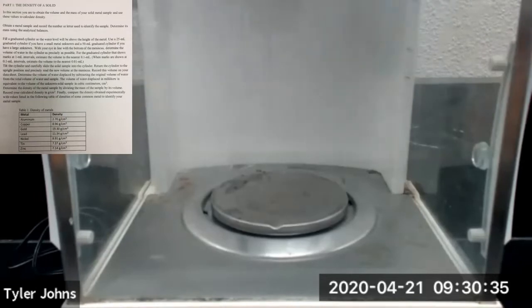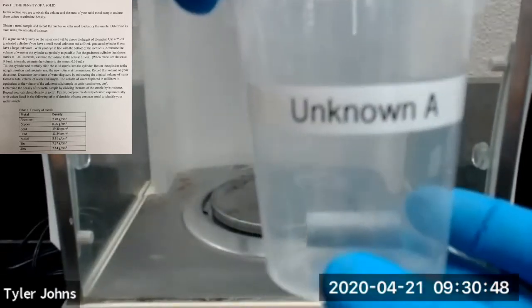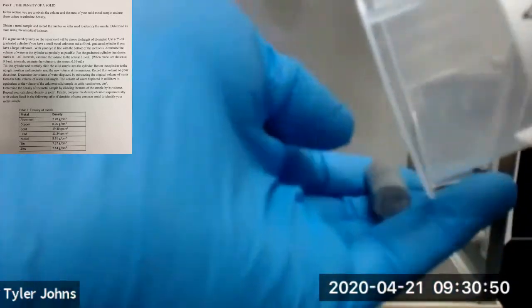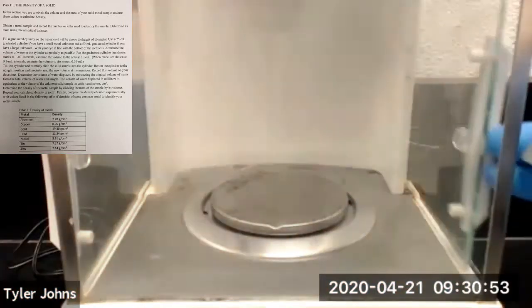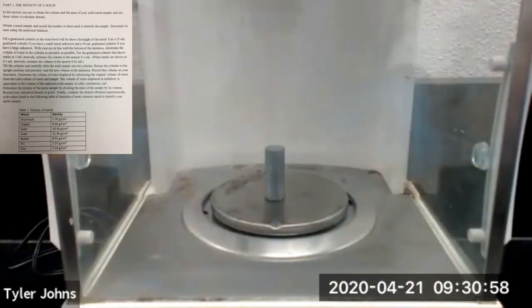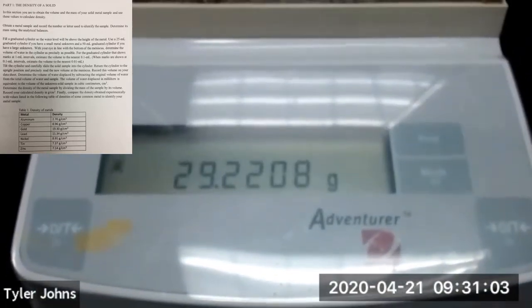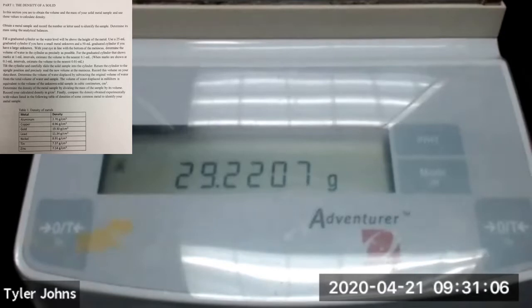For part one of this experiment, we're going to be determining the density of unknown solid metal samples. Our first unknown is unknown A. We're going to use our analytical balance, and the mass of unknown A is 29.2207 grams.